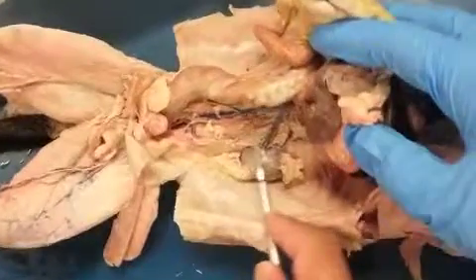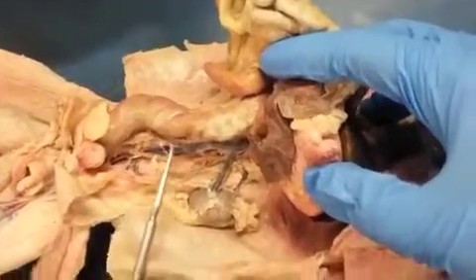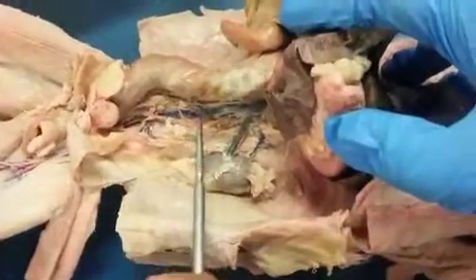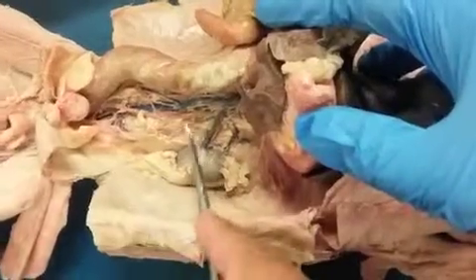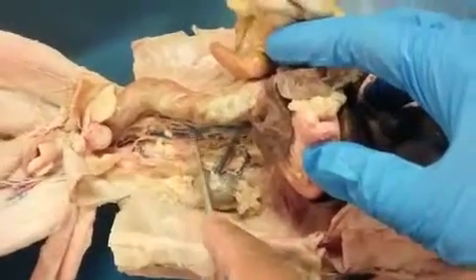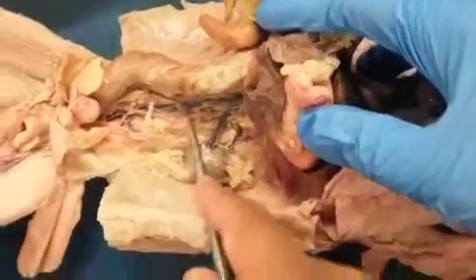And then the only other branches that you have here is the right spermatic vein, draining directly into the vena cava. Male only. Yeah, male. Well, so what's that on a female? Ovarian. And we'll need to know. Or generally you can say gonadal. Oh, so you can just say that. You could say gonadal, you wouldn't be wrong.